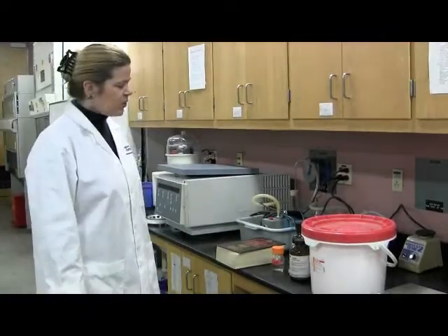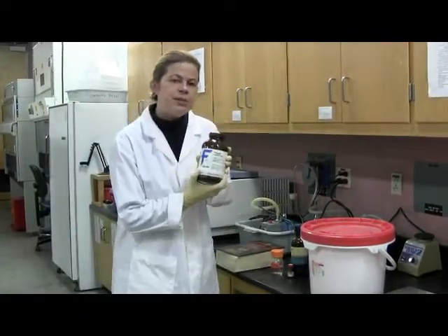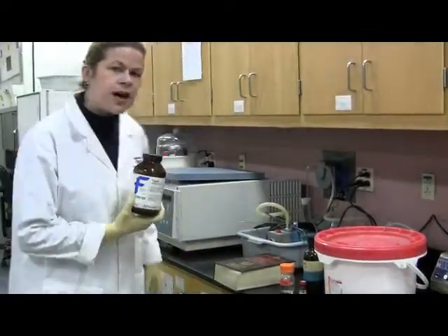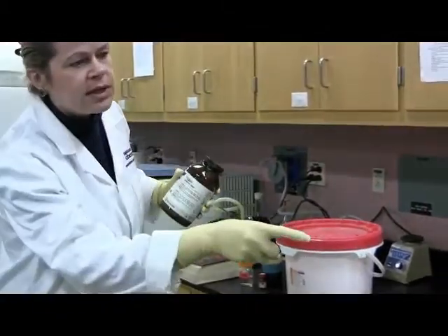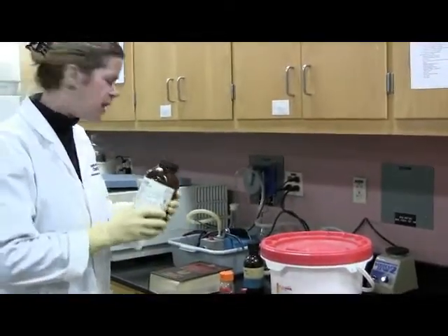Okay, today's lecture is on enzyme kinetics experiment. So, we are going to measure the kinetics of trypsin enzyme. All of these chemicals that you need for this can be found in these cabinets here. Okay, trypsin starts with a T, so we're going to look in the cabinet that has a T on the door. Okay, I know you can figure that out.